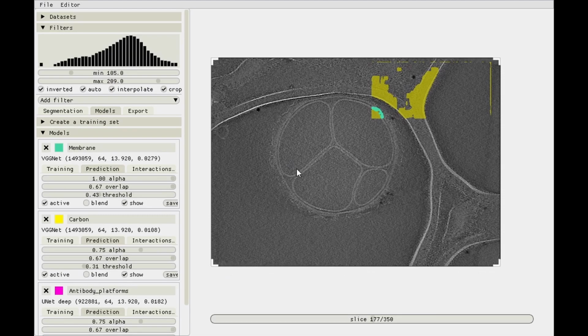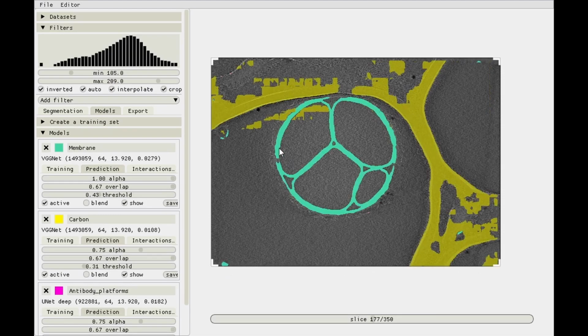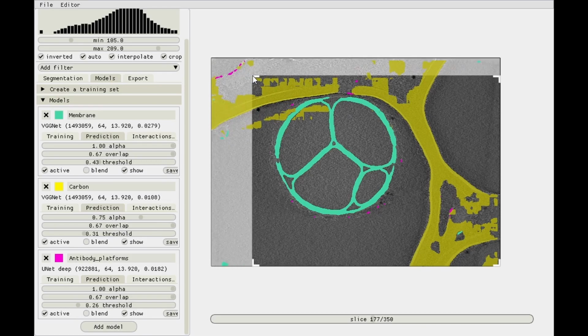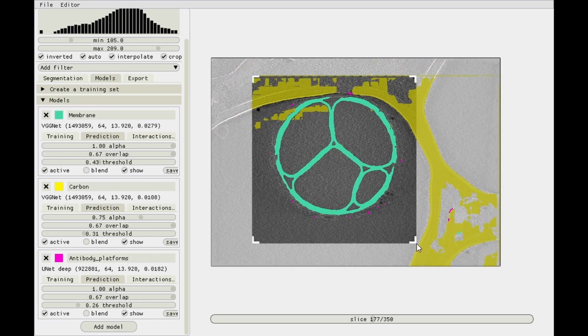Let's see how it does now. Okay, so we get rid of most of the pink stuff. There is still some over here, which is good, and then some stuff over here which we don't really like, and also there. Another easy way of getting rid of it, but it's cheating a little bit, is just to set the region of interest to only this bit.